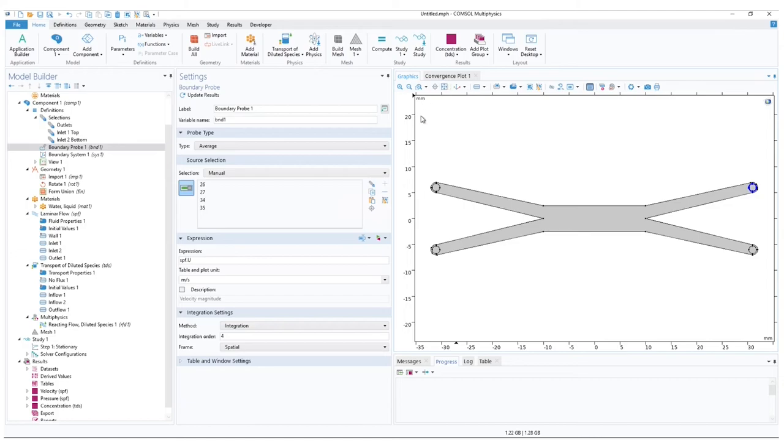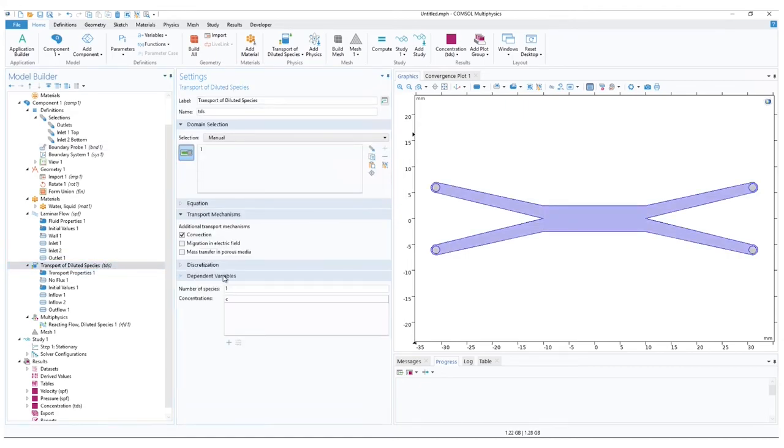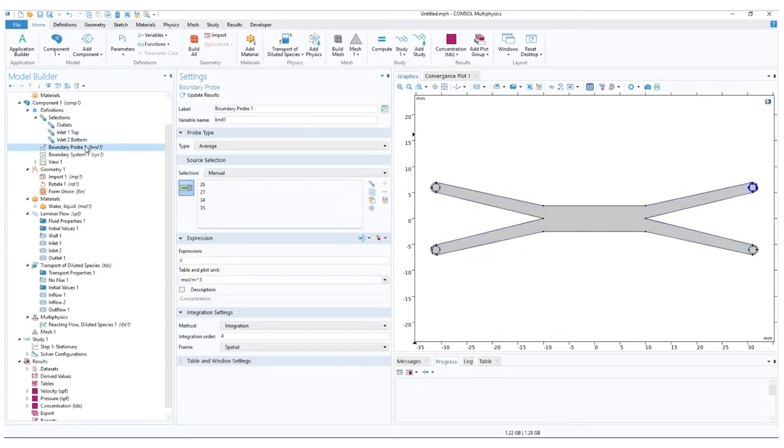As we want to measure the average concentration at the outlet, change the expression to c. The expression c, or the concentration variable, is taken from the transport of diluted species physics. You can click on the physics, expand the dependent variables, and locate the variables available. Coming back to the probe, let us also change the unit volume to liters instead of cubic meters. To identify the probe, we already have a default description of concentration, but let us label it as outlet top.